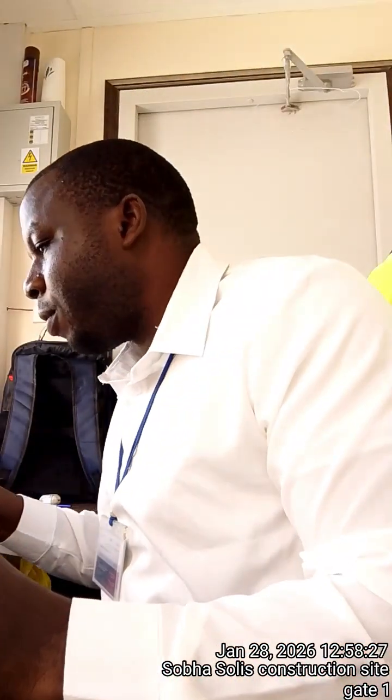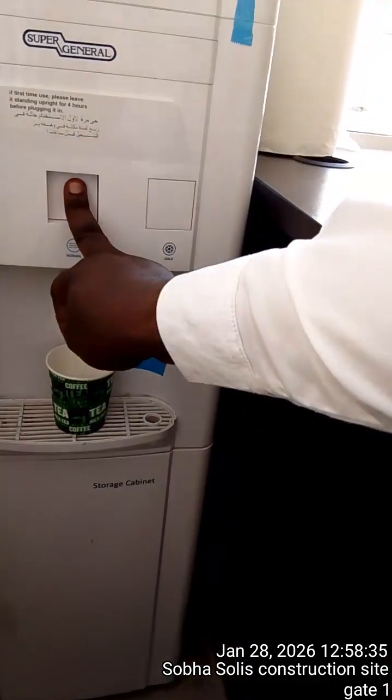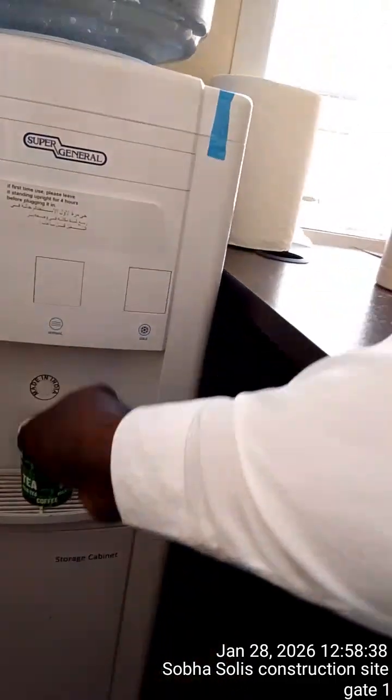Like I told you earlier on, I'm fetching water from the tap. Now I have water here, and this water is my normal drinking water, distilled drinking water. So I have two samples so far collected. So dear members, here I have two types of water. This is tap water, this is drinking water, purified drinking water.